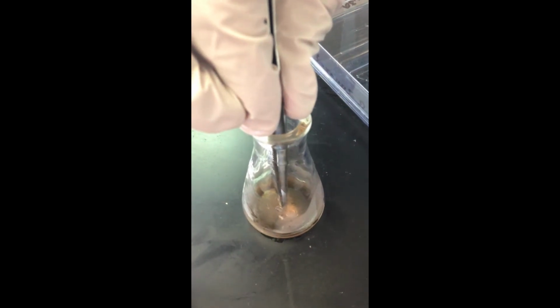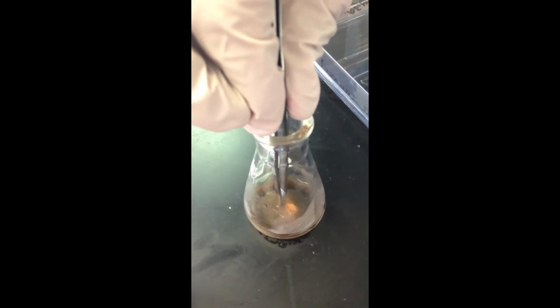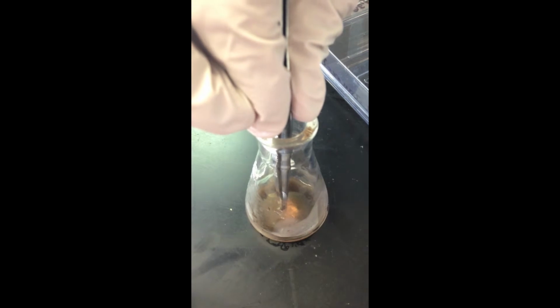Three chads were dipped into cold temperature, or 18 degrees Celsius, catalase enzymes for 15 seconds. The chads were dropped into a 3% hydrogen peroxide solution. The reaction rate was timed and recorded.